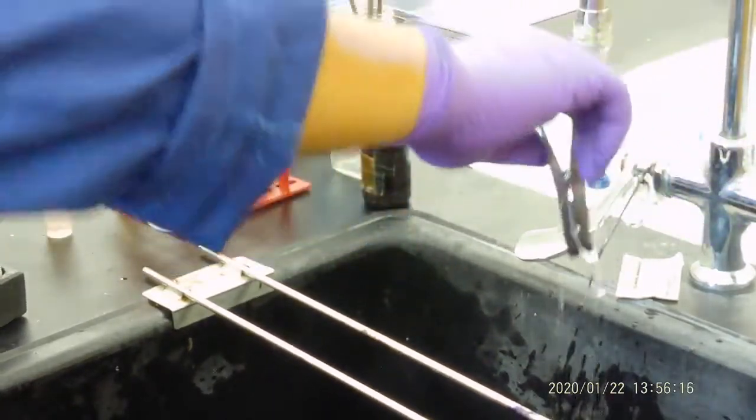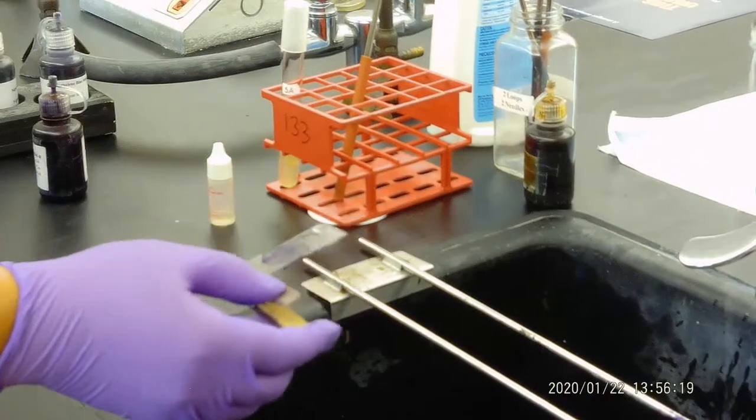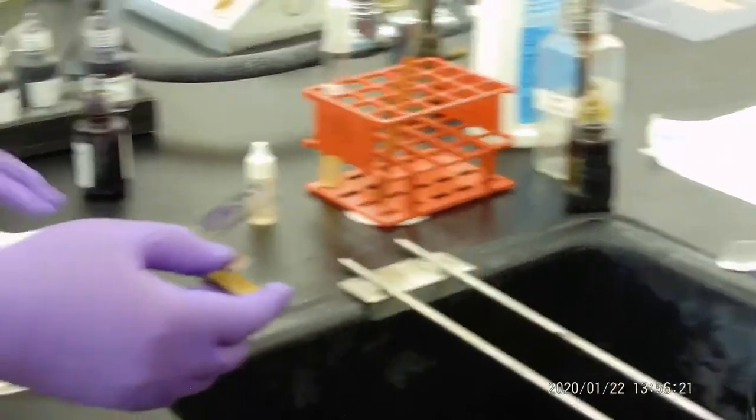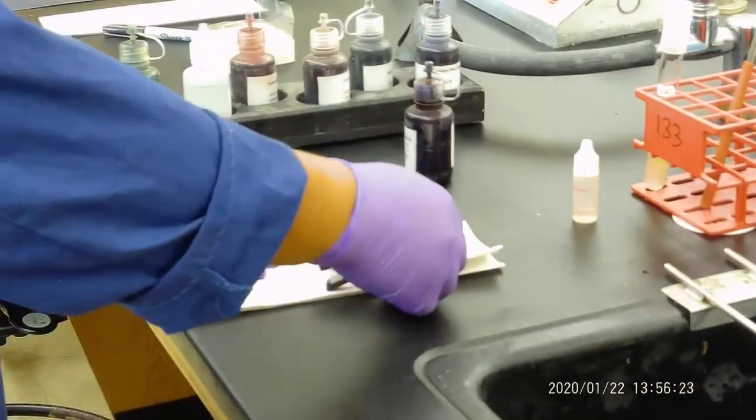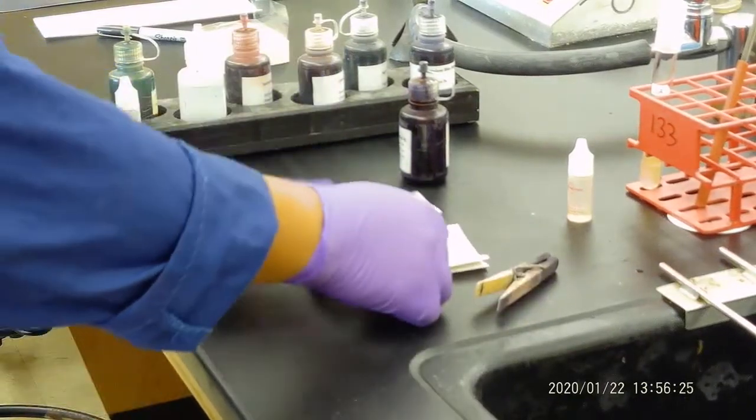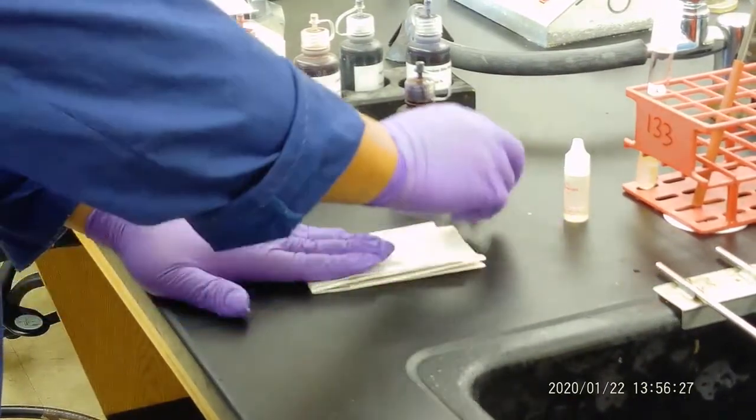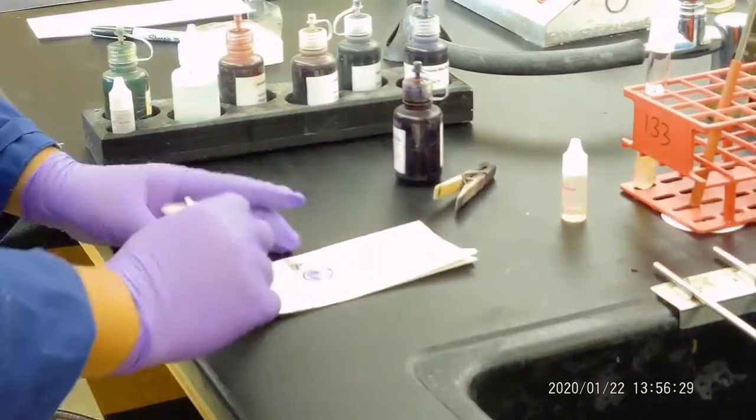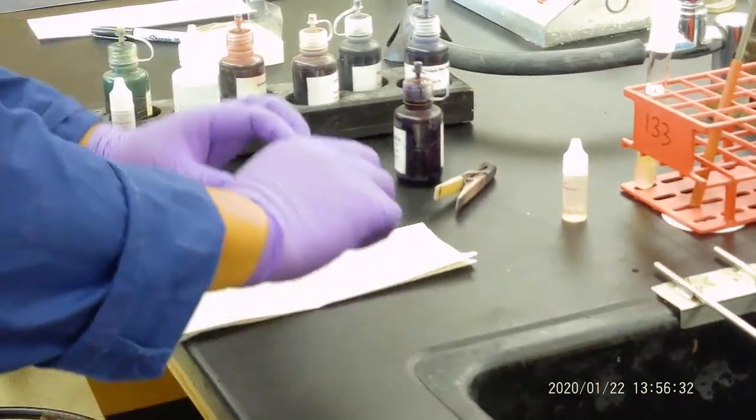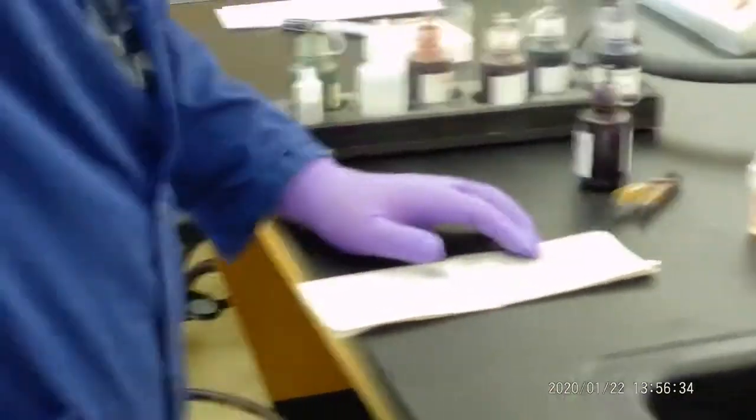Now, after doing this, you need to have a paper towel. We will be just very gentle to press it, very gentle to press it. And this should be ready to go. It should look like that.